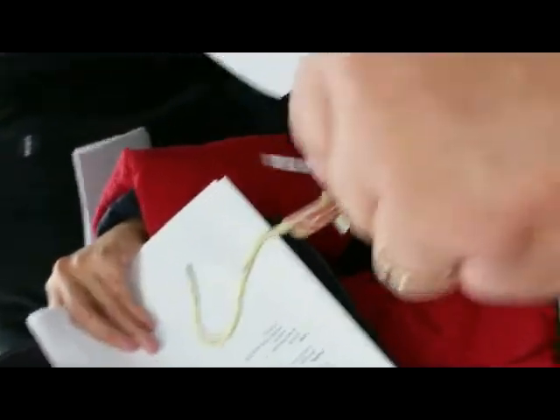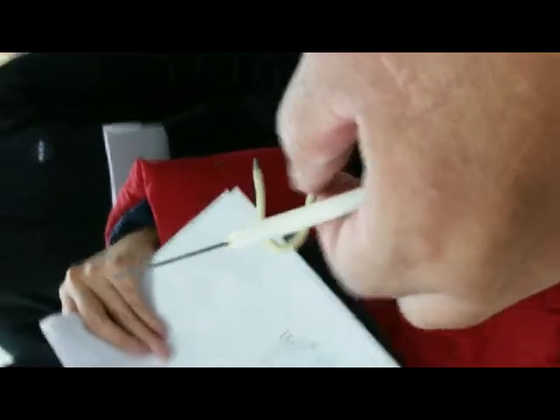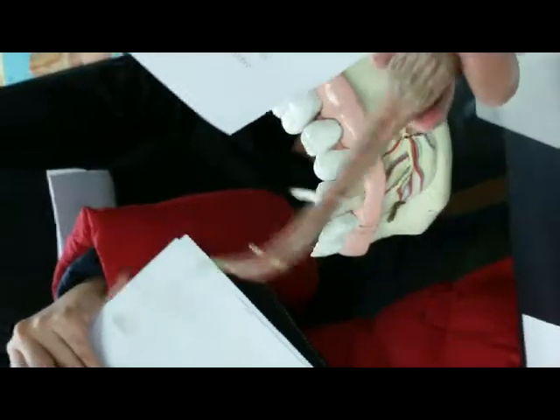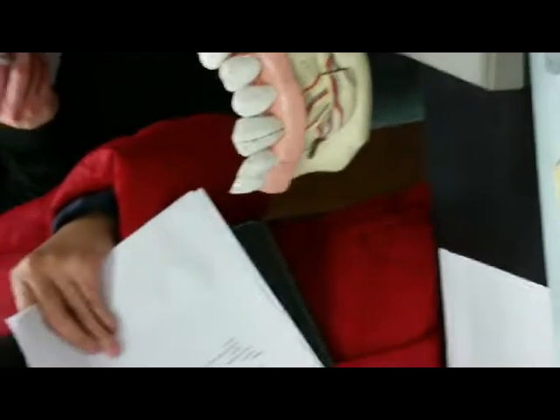And what would this be sticking out there? The vas deferens or the ductus deferens. And up here would be what? Spermatic cord. So now you have the spermatic cord that includes some of the muscles, and that you don't see, the testicular artery, testicular vein, and the cremaster muscle. That's called the cremaster muscle. Let's show you another testis.